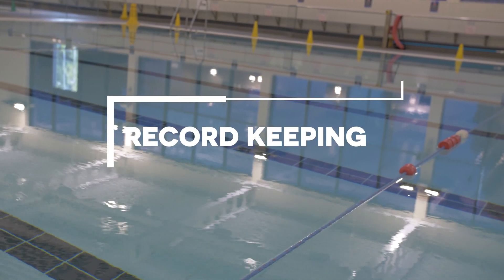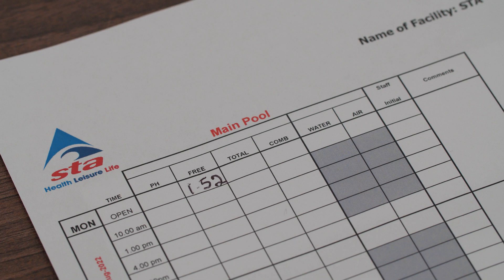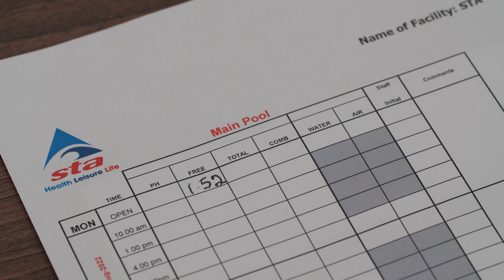It is essential that all pool tests are recorded. Pool tests can be recorded on pool log sheets or by using software such as STA's ITIS system. Records must be kept for at least five years.